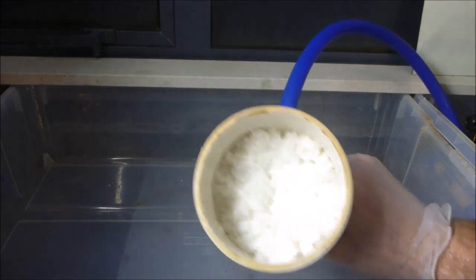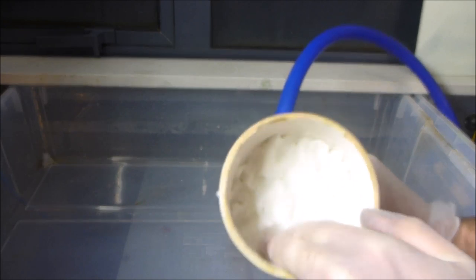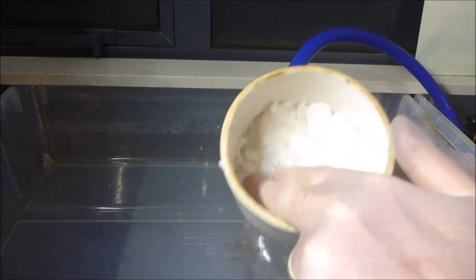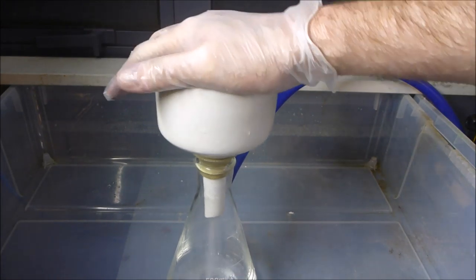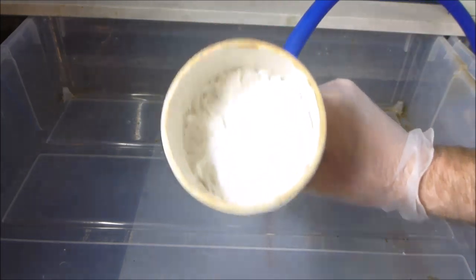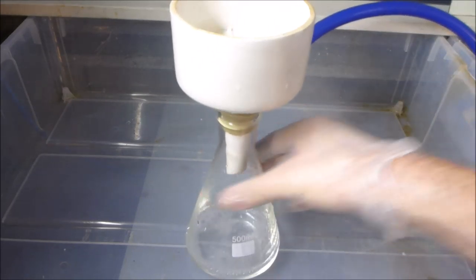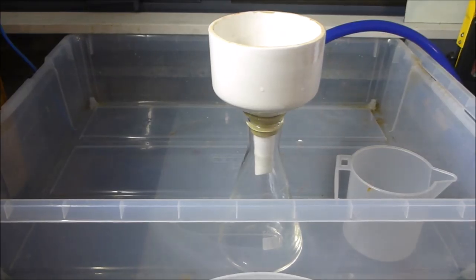Okay, so show you guys what that looks like. So it's kind of hard to see there, but you can see I've just basically squished all those bits of paper over the top of the actual filter paper, the bits of paper towel, and now I'm just going to give it a little bit of a vacuum, so you'll see all of the water being sucked out of the towel up here. And that's fine. I'm just going to dispose of this water, and then we're basically ready to start filtering our very dirty solution. Okay, we're all set up, guys.